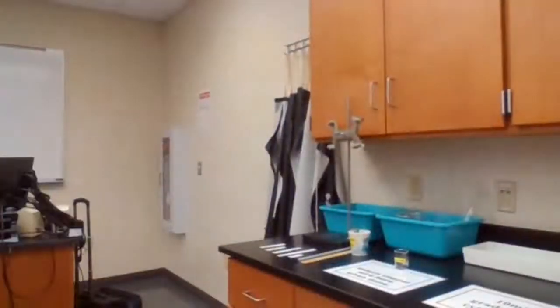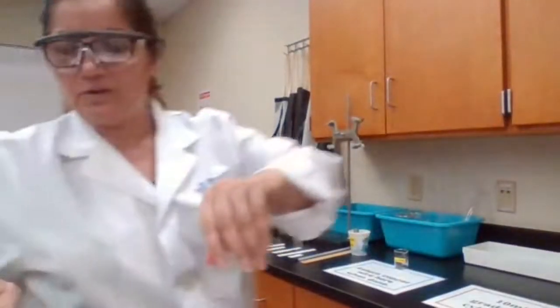Because it's exactly at 5.3, I'm going to record it as 5.30. So for number 1, it's going to be 5.30 milliliter.